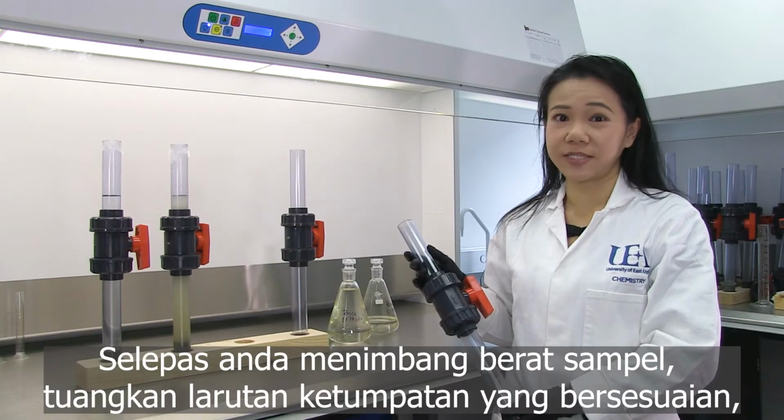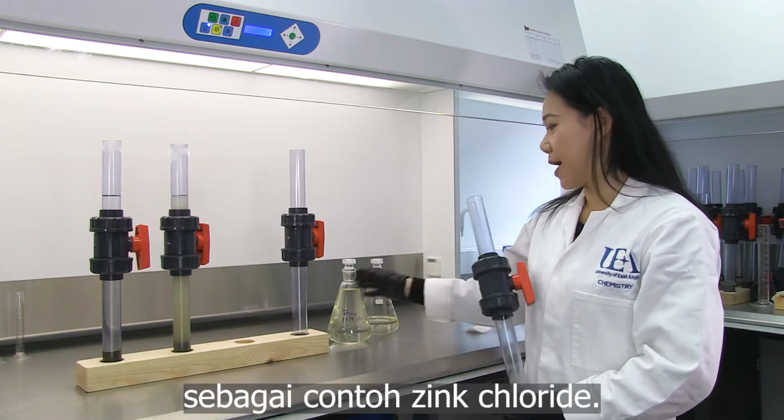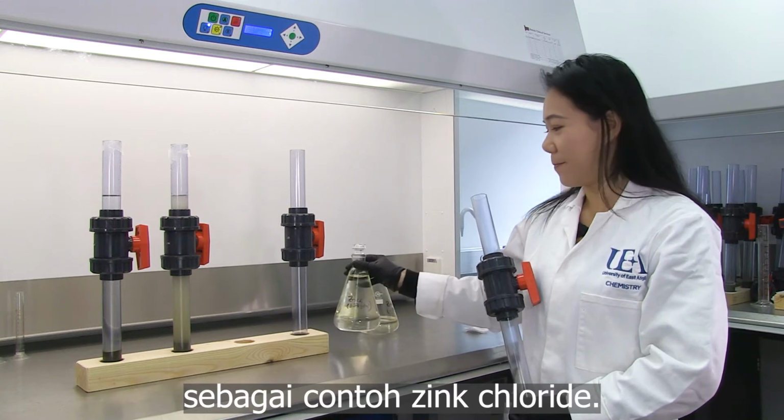After you have weighed your sample, pour in a suitable density solution, for example, zinc chloride.